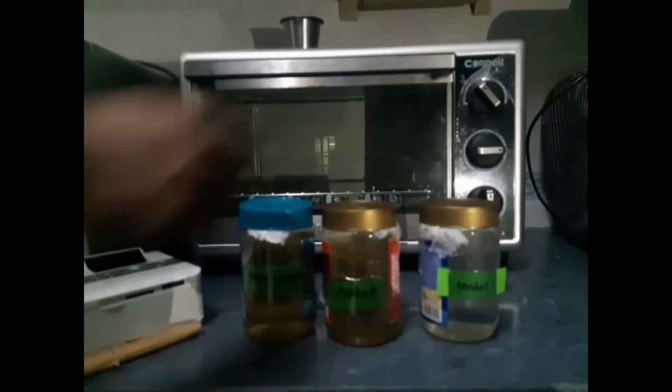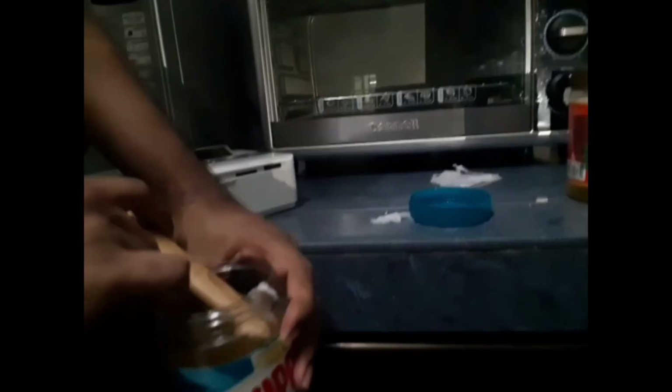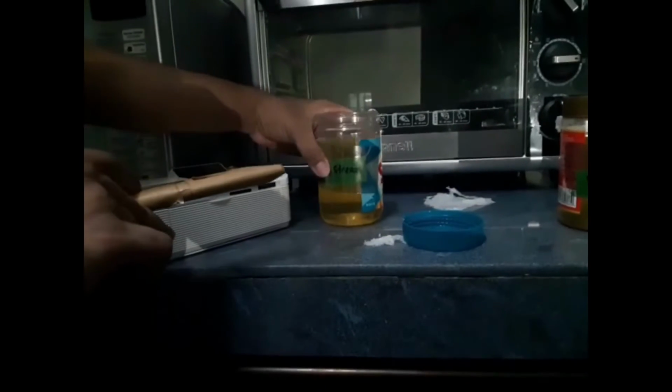And we will follow the same procedure where we will be opening the jars and using the oxygen meter, dipping it in until a beep is heard and a constant reading is obtained. The final DO will be recorded. The probe will be cleaned again with water and the same procedure will follow for the other containers.